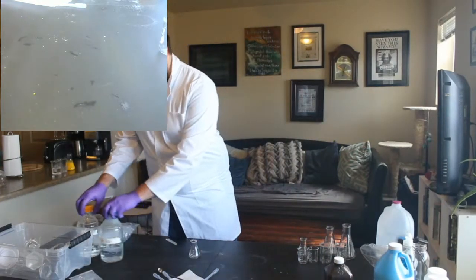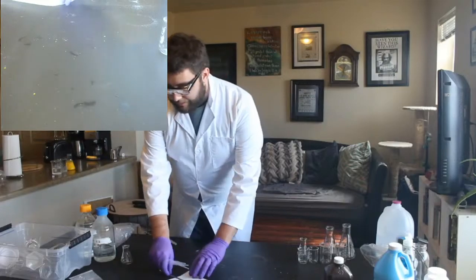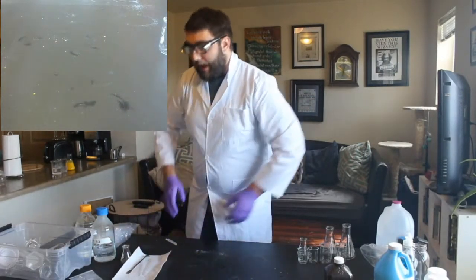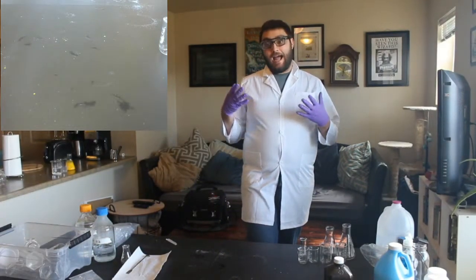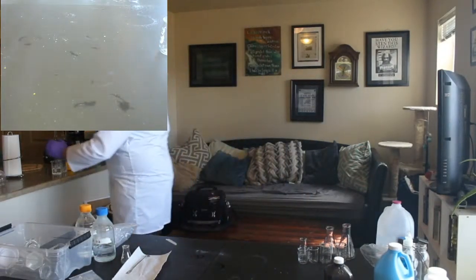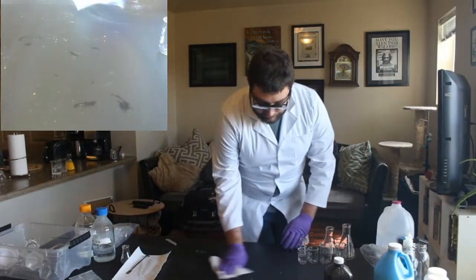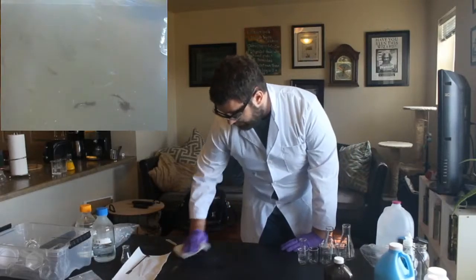Keep them coming. So now, what we're going to do is we're going to get into the follow along section. And this is going to be what's called an iodine clock. So I didn't prep anything in advance because I wanted to show how I do the preparation. So I'm going to just wipe off my table and then hopefully we'll be able to see everything.